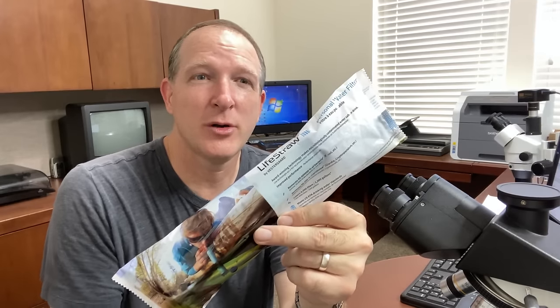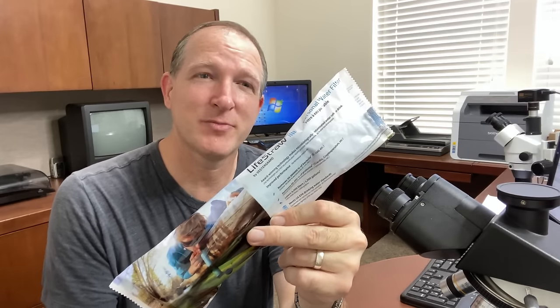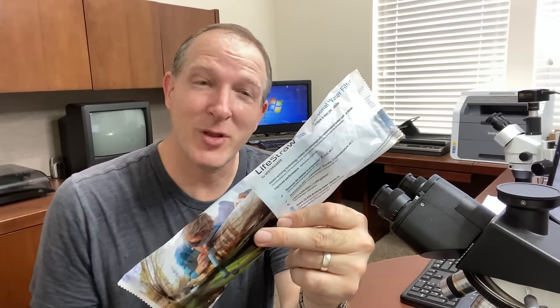Did you ever wonder if these LifeStraw filters really work? Think about it. If you drank some dirty water and it didn't work, you could be letting in some very dangerous parasites into your body. Well, today I'm going to put it to the test with a microscope.